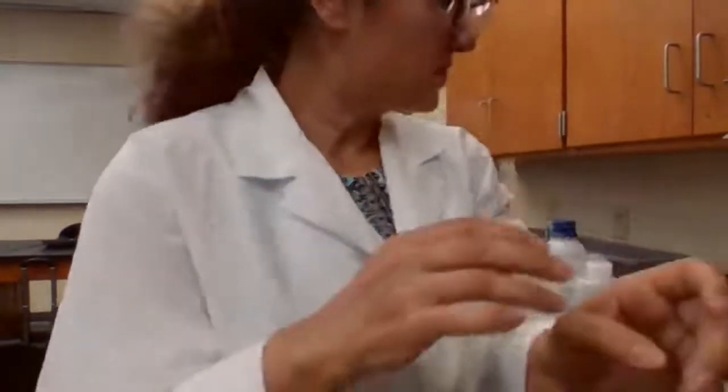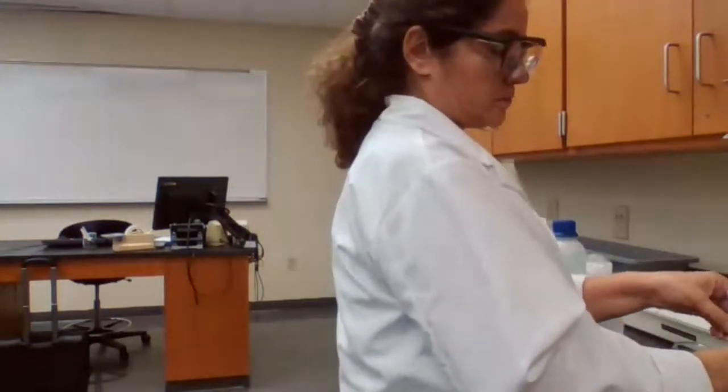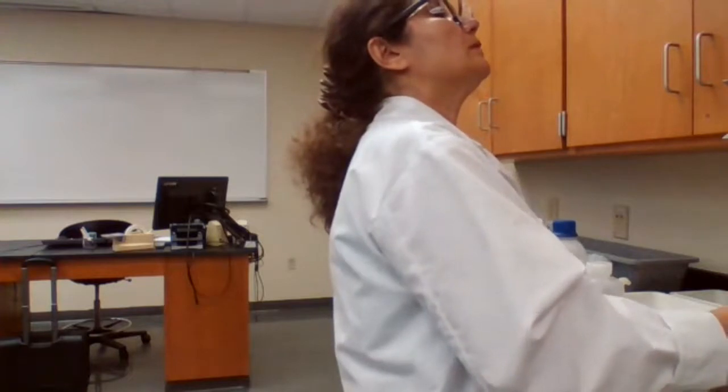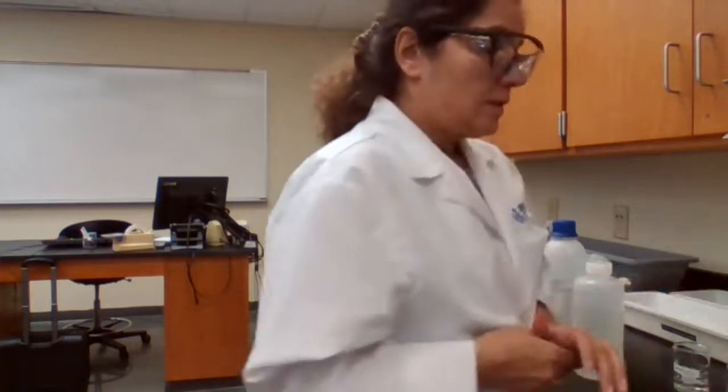17 milliliter, pH equals 5.09. 5.26 for 17.5. 18 milliliter, pH equals 5.46.